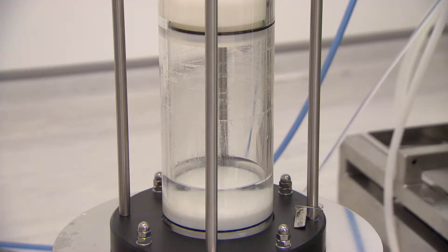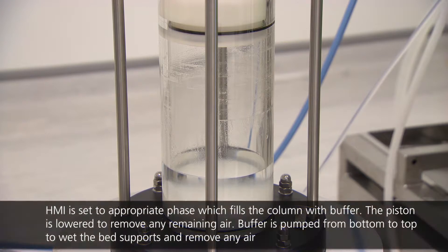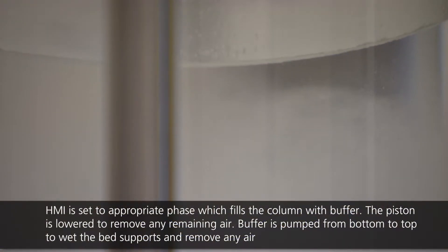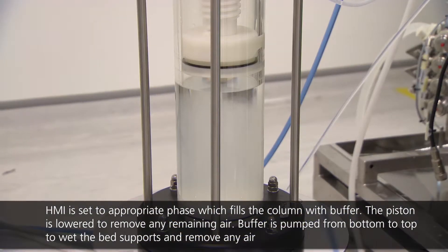The bottom bed support is primed by pumping buffer through it. It is important to properly prime the column such that any air trapped in the bed support is removed prior to operation.